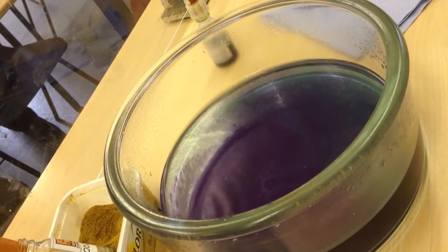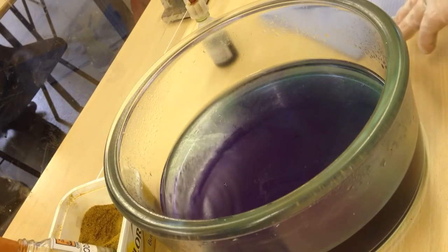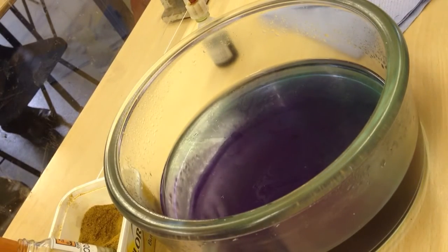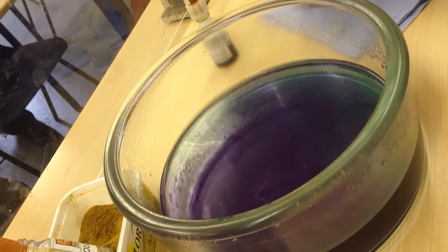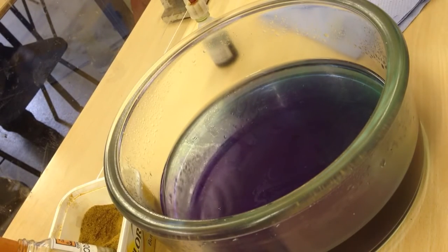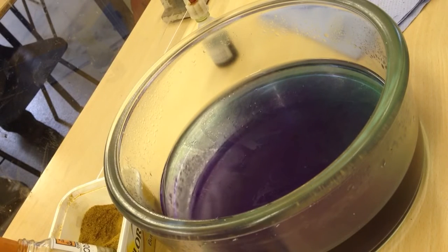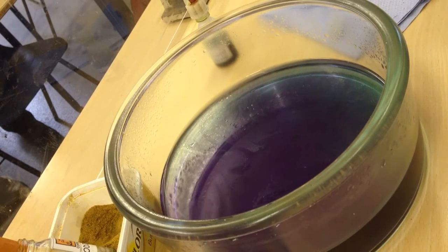So, what is below sodium on the periodic table for me, please? Potassium. Potassium. Excellent. Thank you. Right, I'm just going to get some potassium out. Excellent. Nice lump of potassium here.